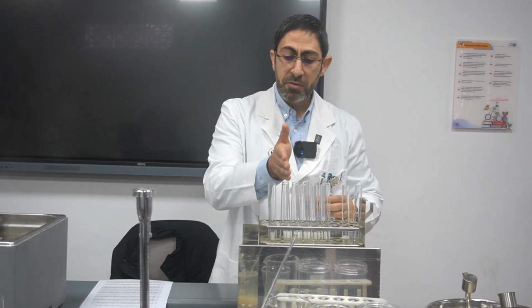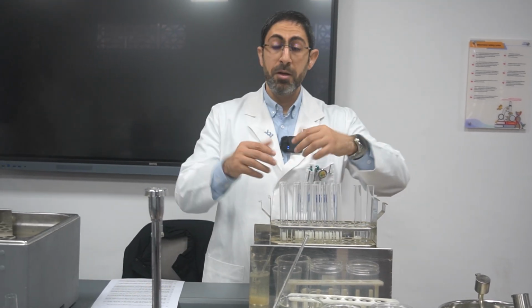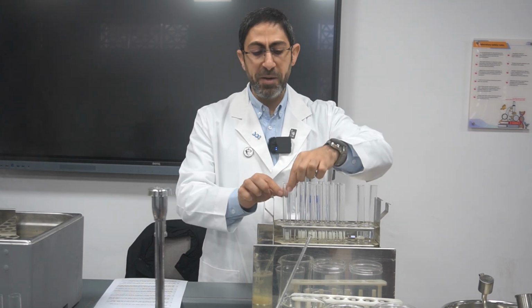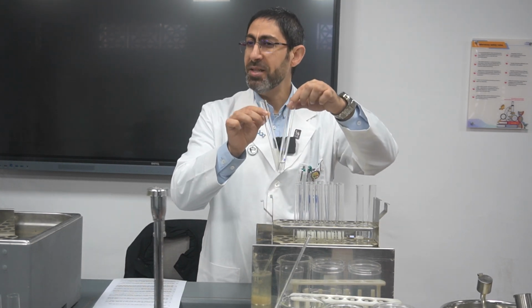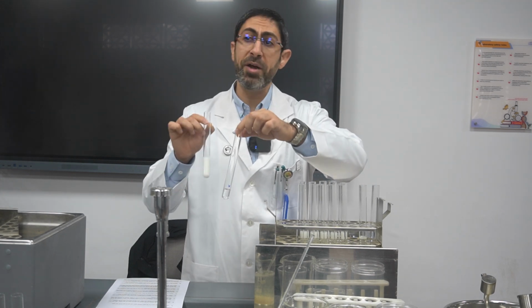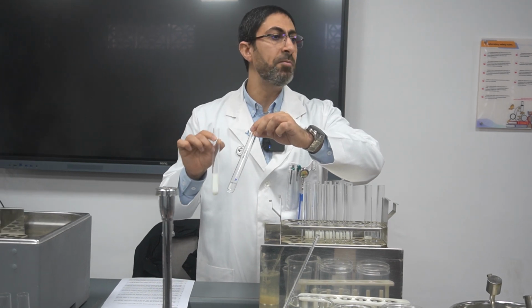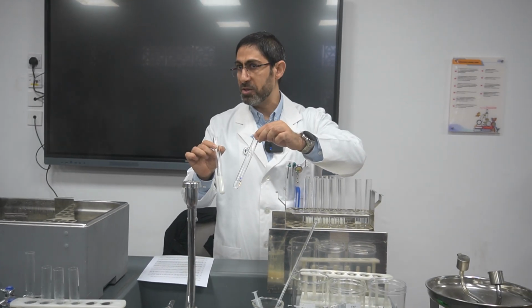I have to do this for 6 consecutive test tubes. Before starting the experiment, I have to place those 2 test tubes at the same temperature that I will work on, in order to equilibrate them so that each has the same starting temperature.